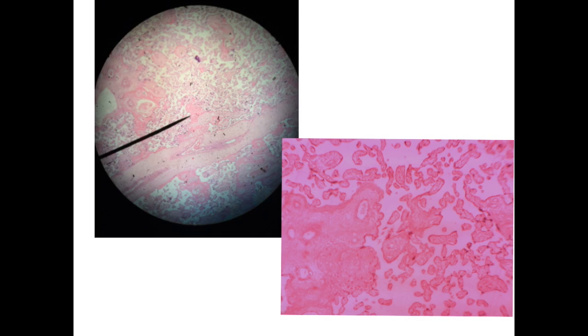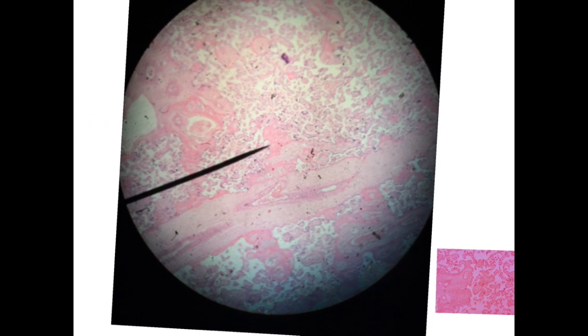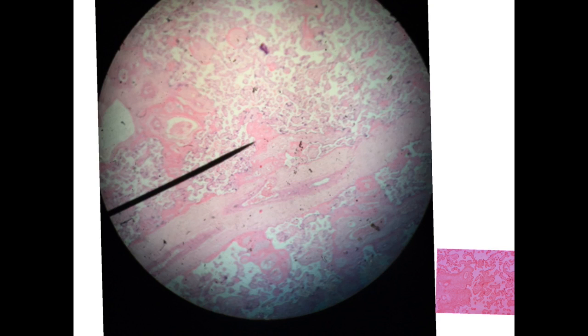The third spongy structure is the placenta. Here we have the picture of the placenta under the microscope. Here we have the chorionic villi, containing blood vessels inside, and also these are sections of chorionic villi of different sizes, smaller, larger, and in between the villi you may notice blood or not, but these chorionic villi are characterized in the large ones by the presence of this chorionic blood vessel, and these are the cells surrounding the blood vessels.